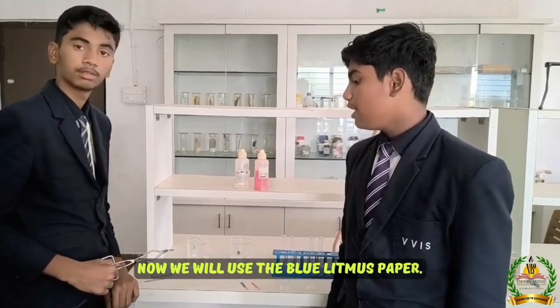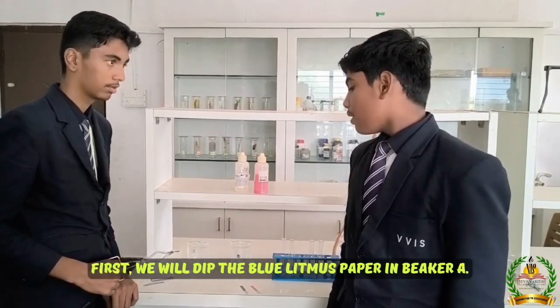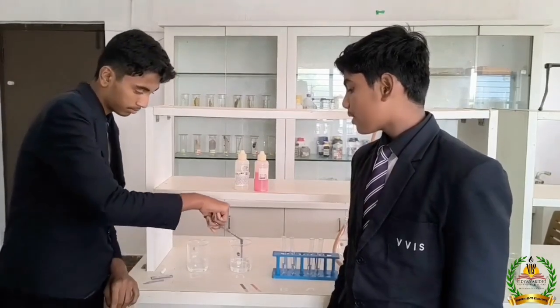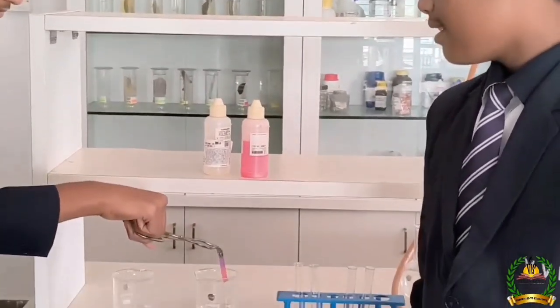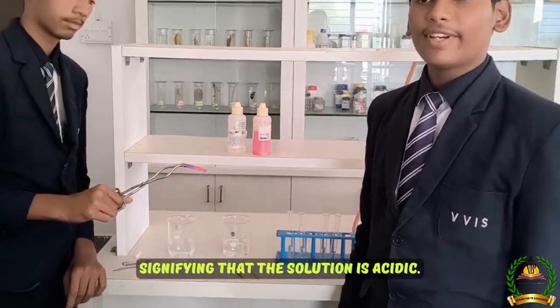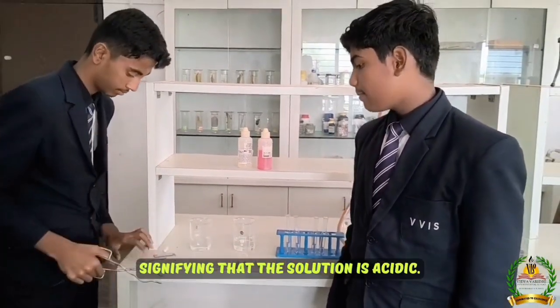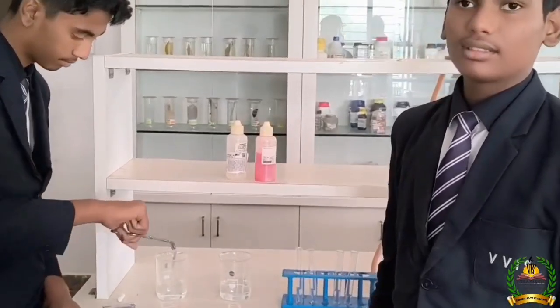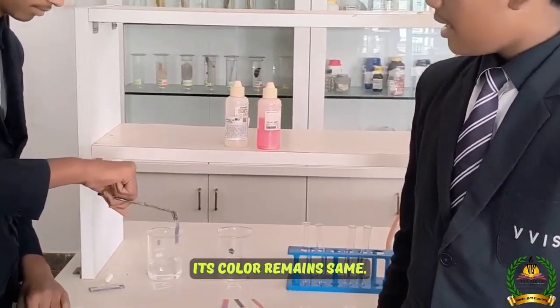Now we will use the blue litmus paper. First we will dip the blue litmus paper in beaker A. Its color changes, signifying that the solution is acidic. Now we will dip the blue litmus paper in beaker B. Its color remains the same.